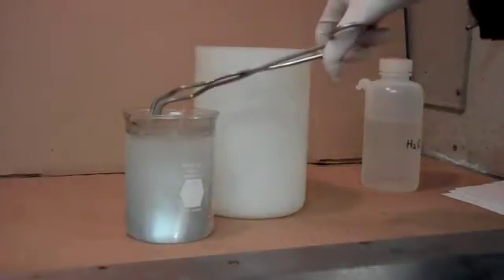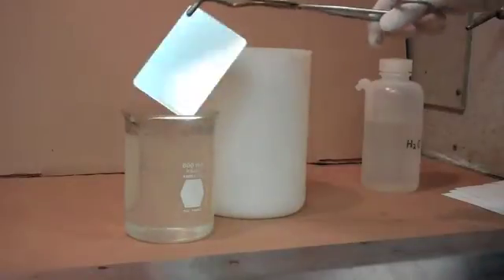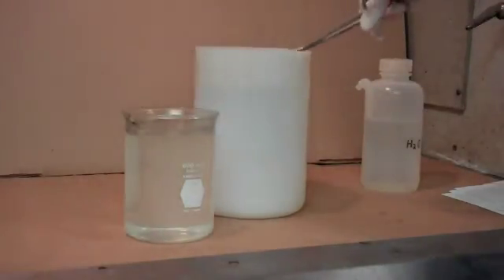As you can see, the acid removed all the zinc, so we want to dip it in some fresh water and remove the acid that is on the panel.